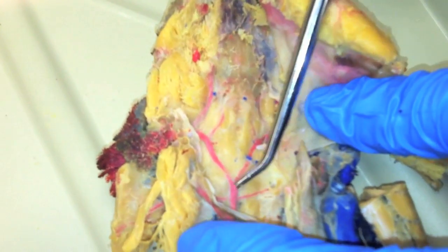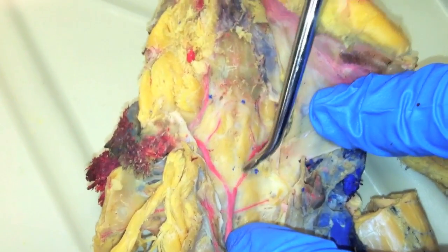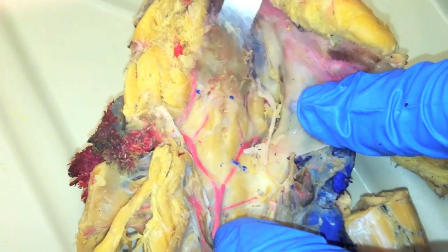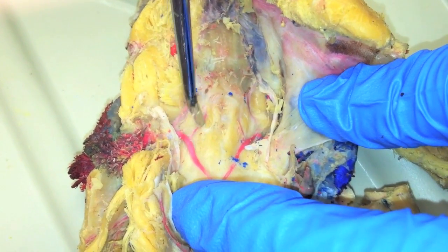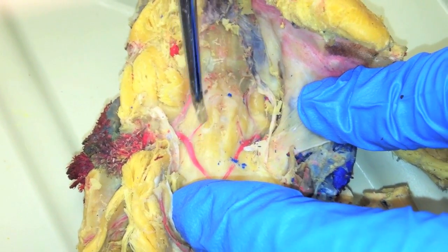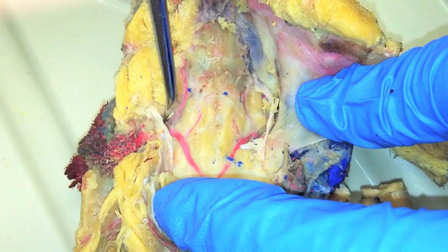Coming off the dorsal aorta — the radices of the dorsal aorta — the first branch is the vertebral arteries, and the next ones are the carotid arteries.